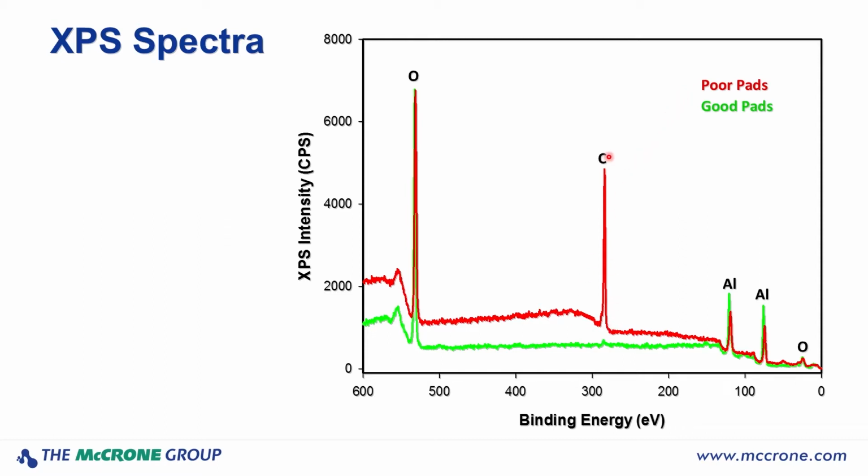And although the photoelectron peak is rather impressive, this is still a very thin film, because we can see the aluminum peaks through this film, if it's continuous. For some analyses, this probably would be sufficient information to say there is a contaminant present on the poor pads, and I'm going to try and eliminate that contaminant to get better performance. But for this particular client, we were asked to do more work to try and identify further the type of contaminant and how much was present.